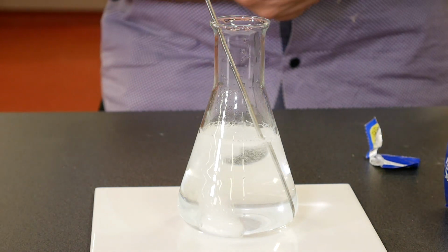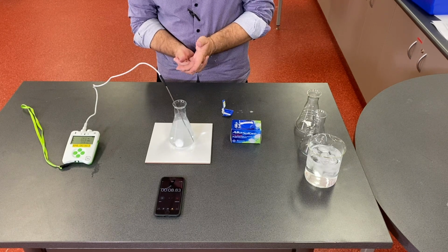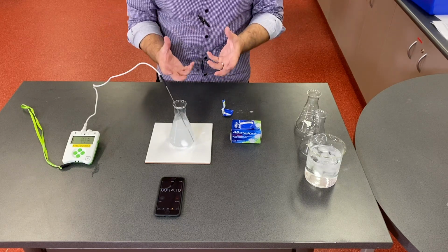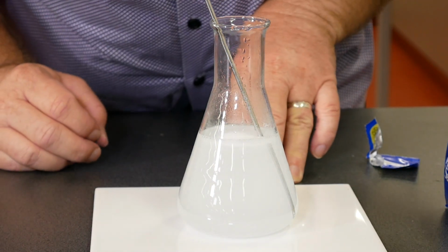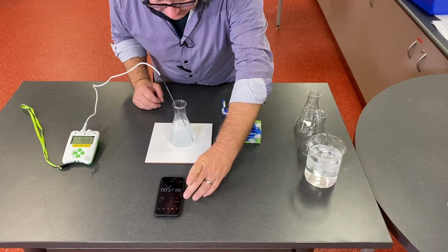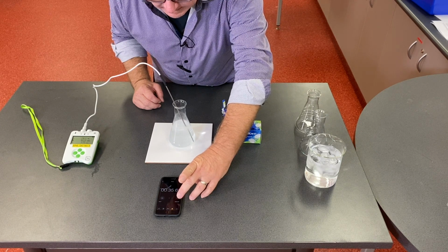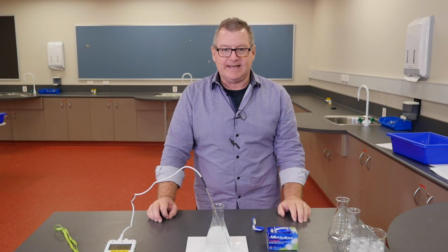You can see it's fizzing pretty wildly at the bottom at this temperature. It floats up at some point because the gases around the tablet are sufficient to make it float, and it'll float to the top. It'll keep dissolving, struggling to see it a little bit, but I think it's completely gone. Not quite. Now, I think it's done. So that's about 36 seconds, 35.98 seconds at that temperature.